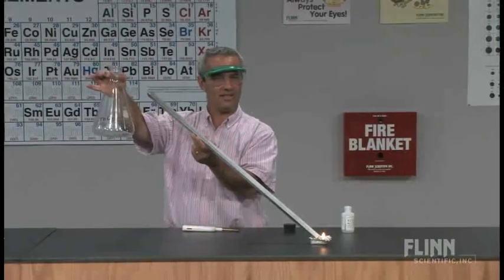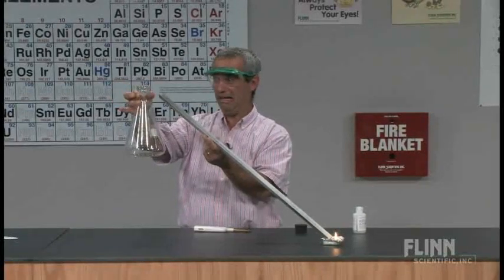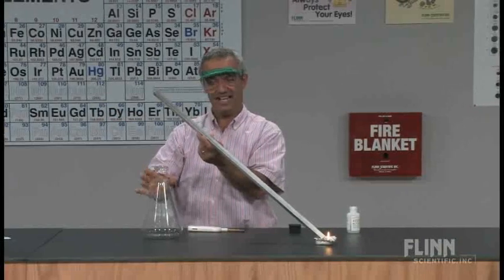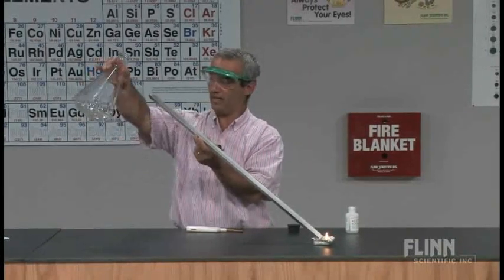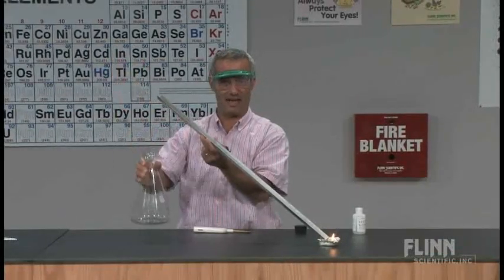It really wasn't a hazard as long as I didn't lose my nerve and go, there's a flame in there, and throw it across the room. That would be unwise. It burnt itself out. Why? There's still plenty of fuel in there. You see the remaining petroleum ether? It obviously ran out of oxygen.